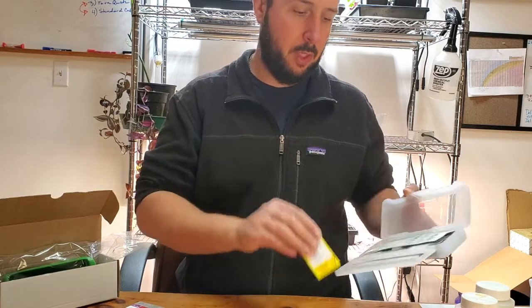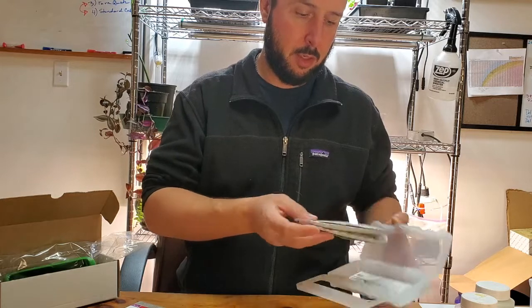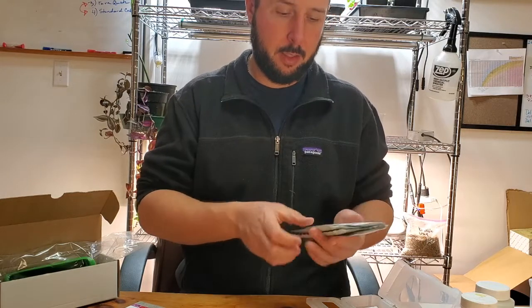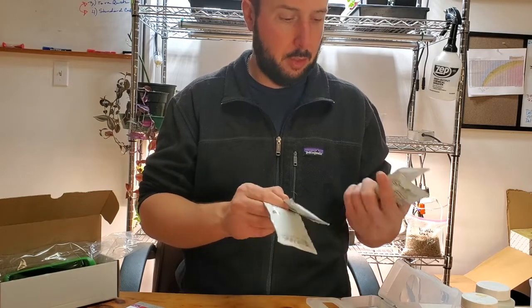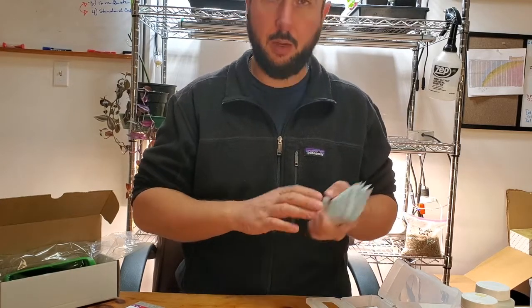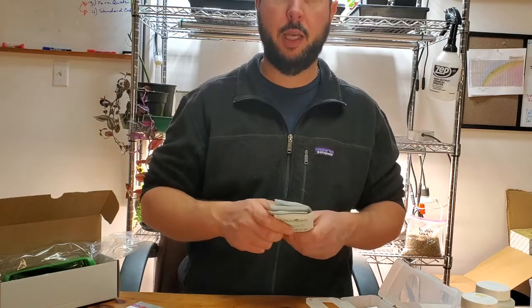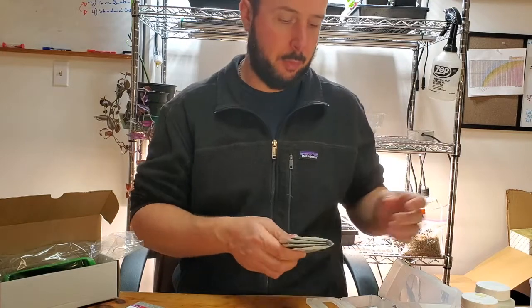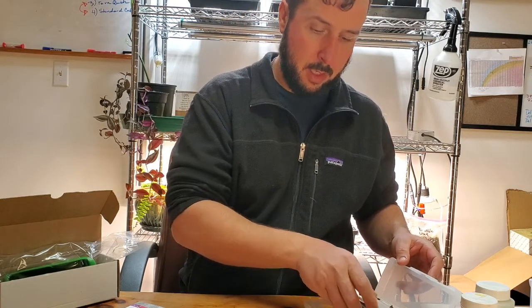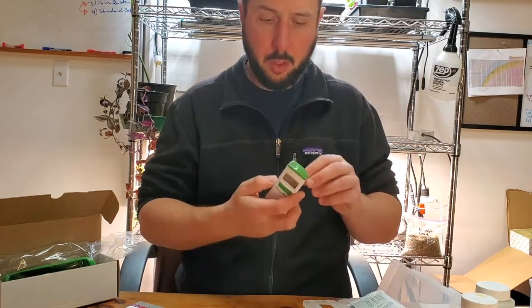It comes with the signature Quick Cal packets and cleaning solution. There's three Quick Cals. You will want to go and get a storage solution - they're sold separately - just get a bottle of that to have on hand.